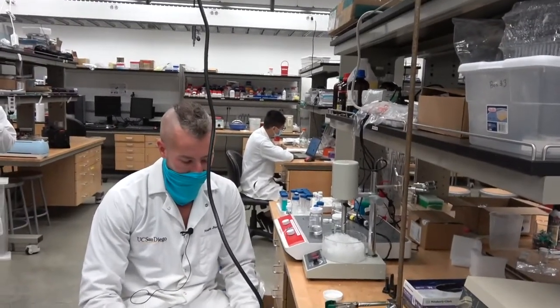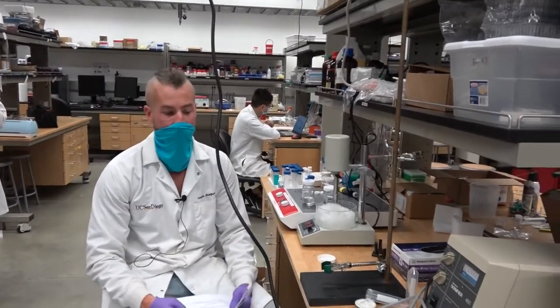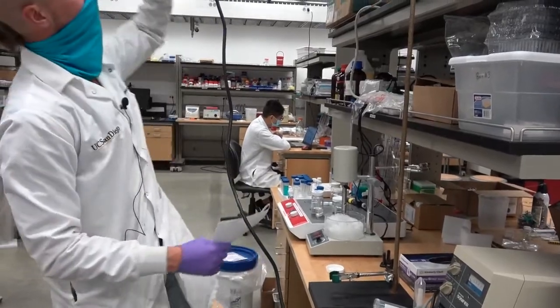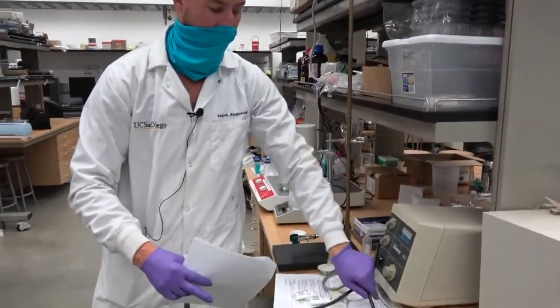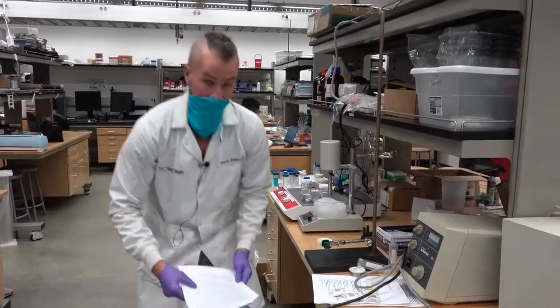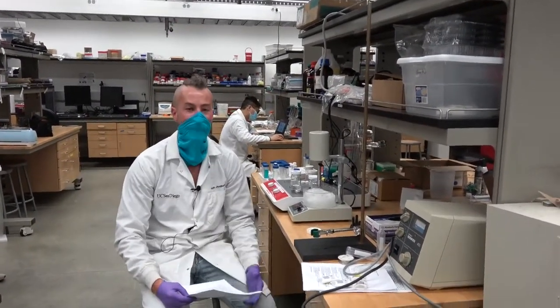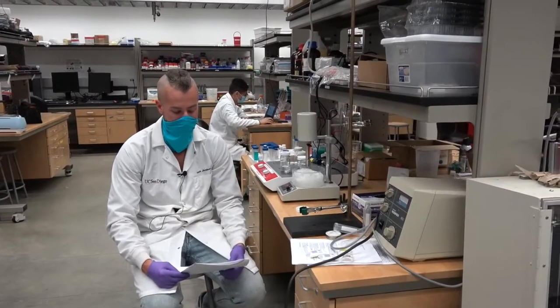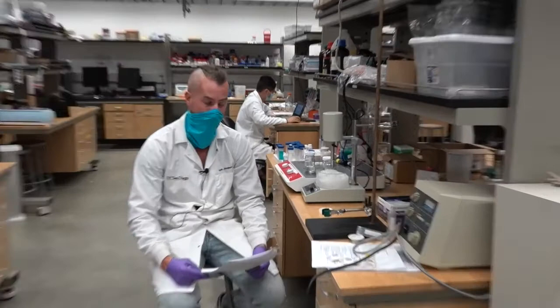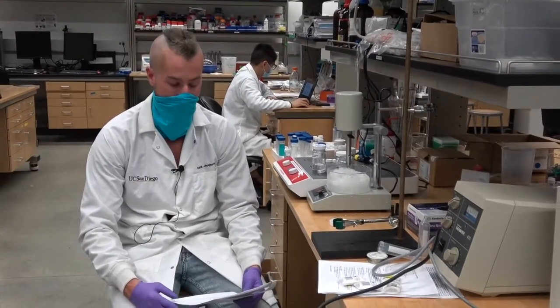Okay, so we're going to dive right in. I'm not going to go through as much detail as I did on the silica one because, frankly, at this point, a lot of these are weigh things out, dissolve it, heat it, and I just don't know that it's the best use of your time to watch a video of me weighing things out.